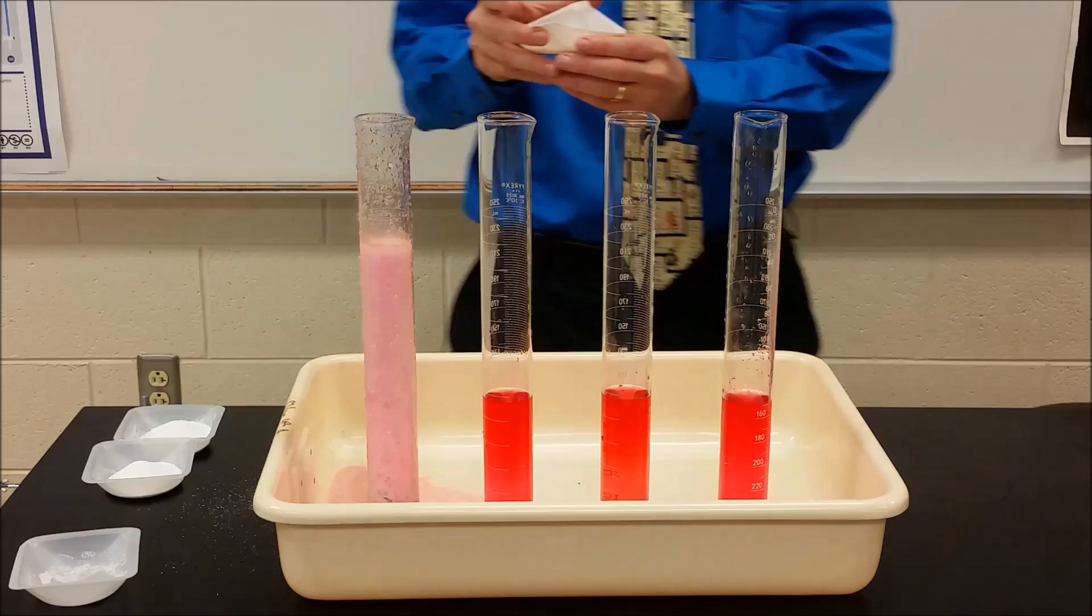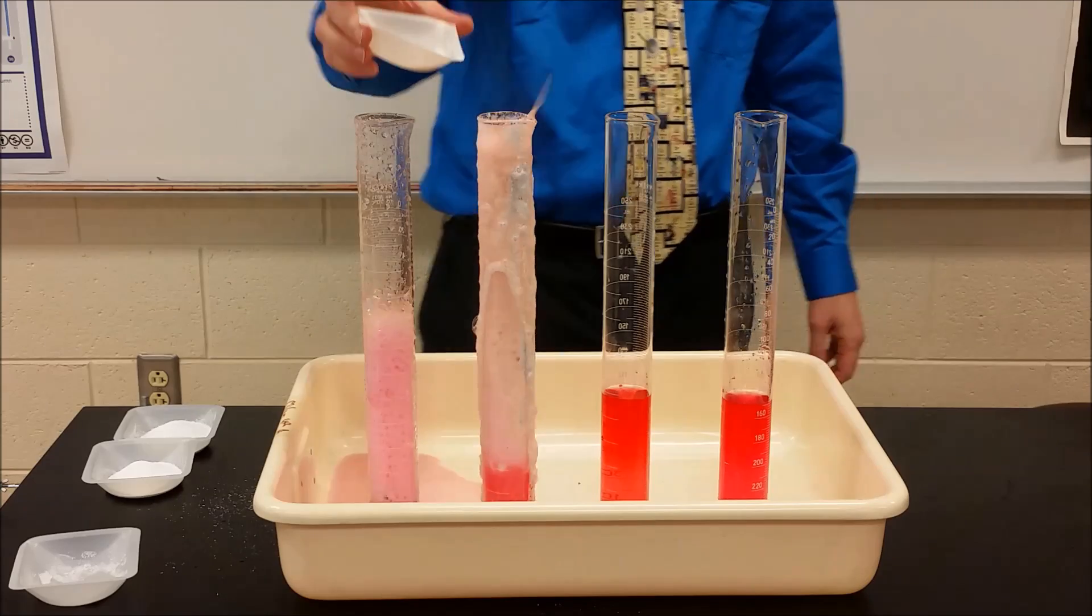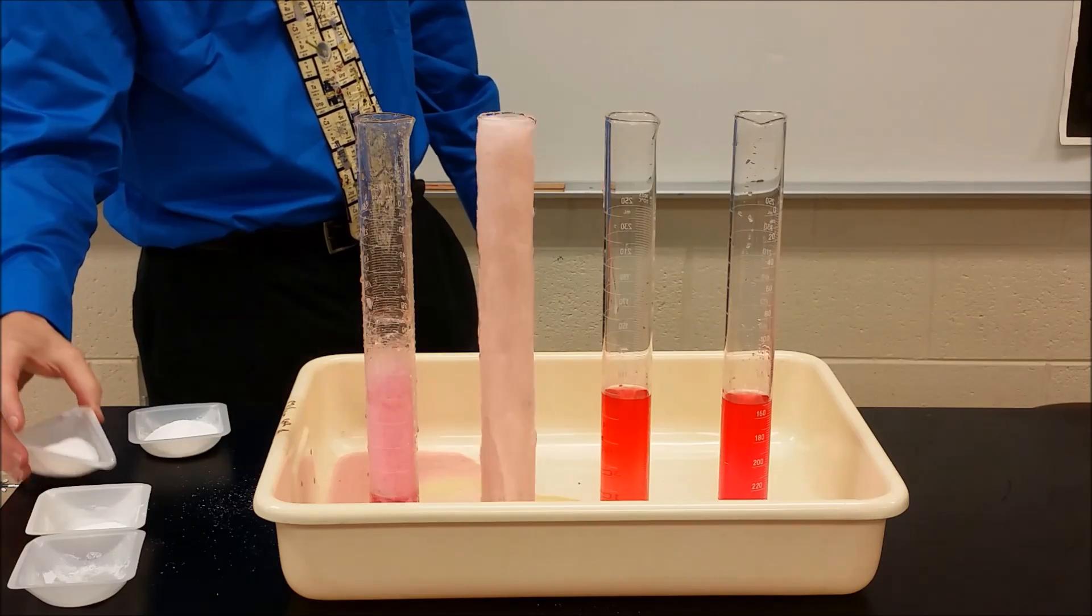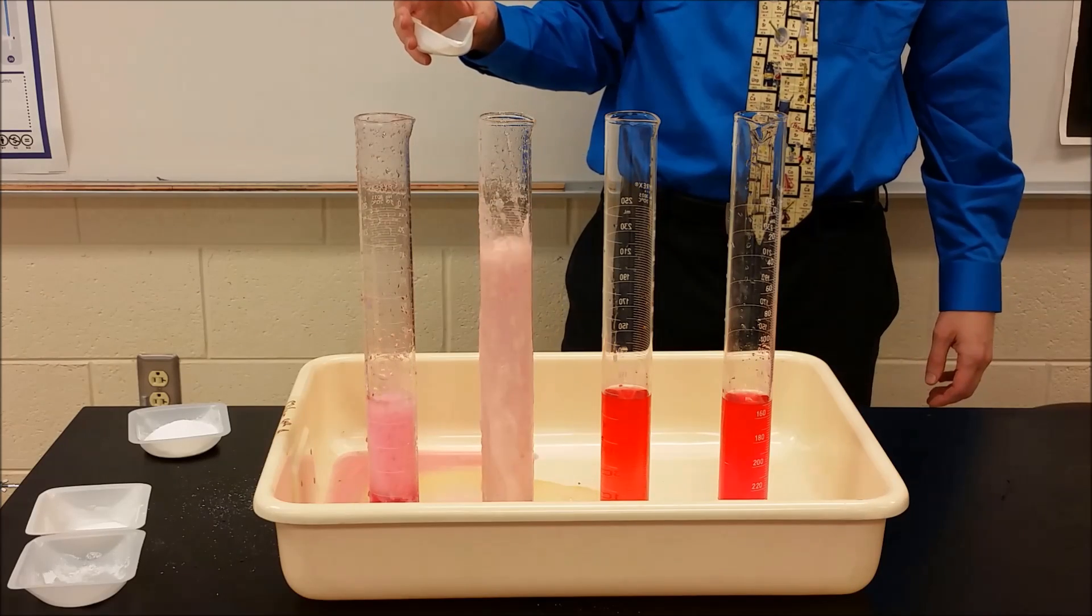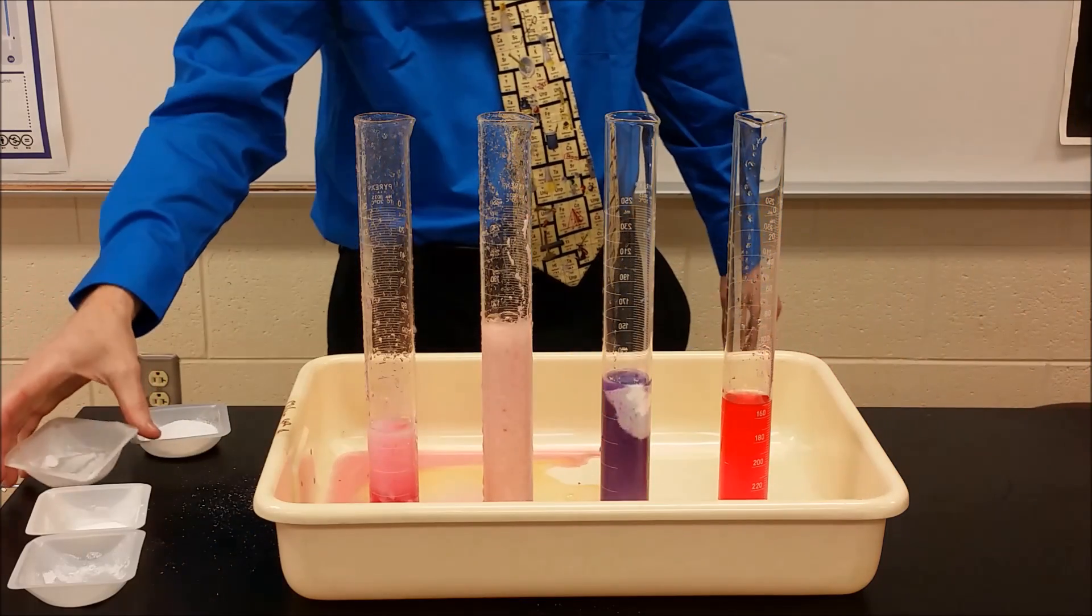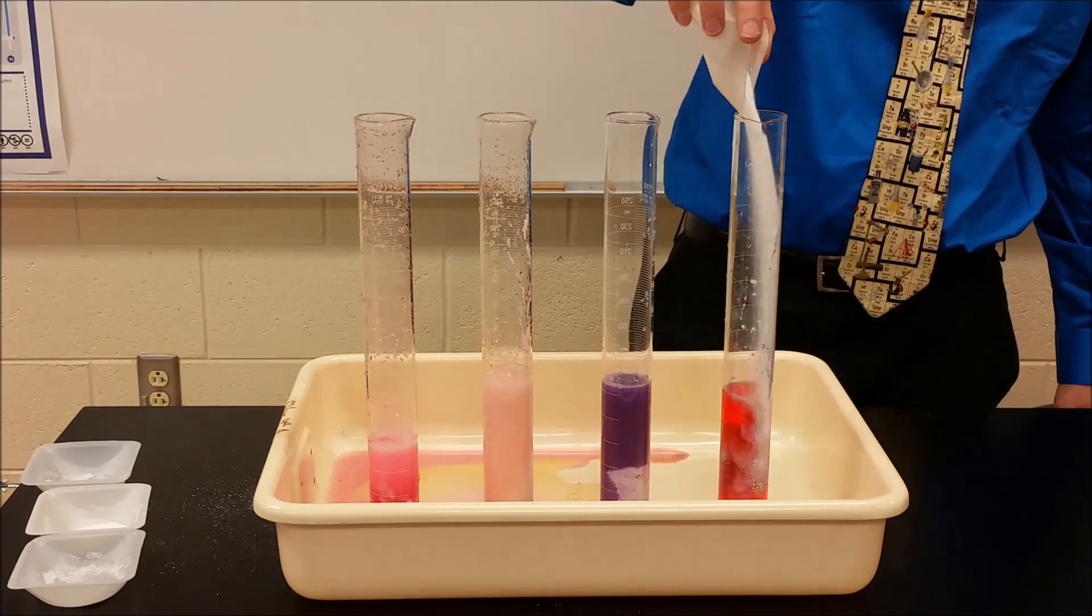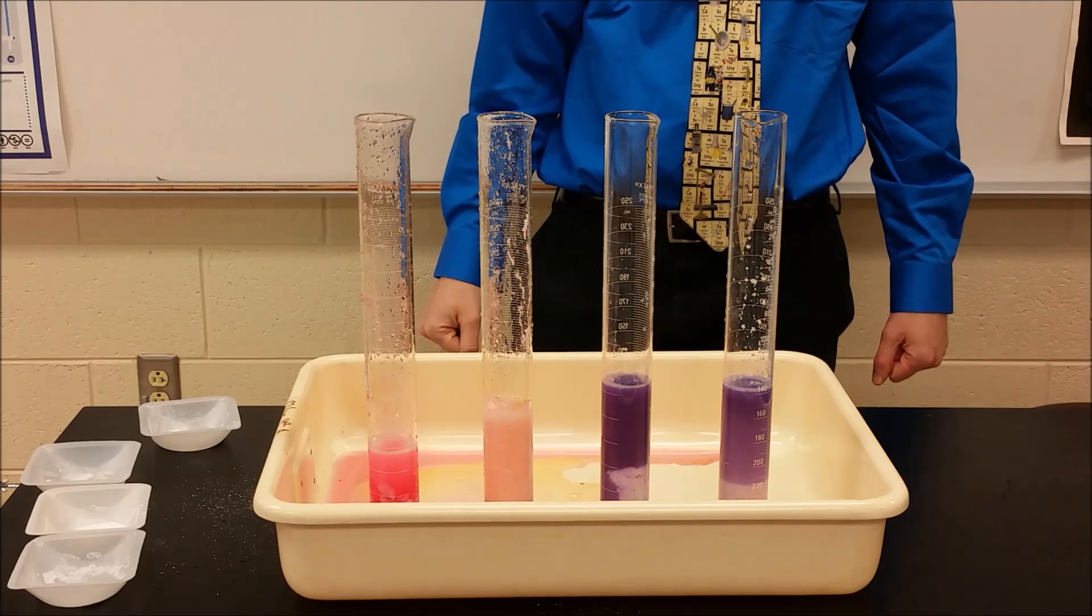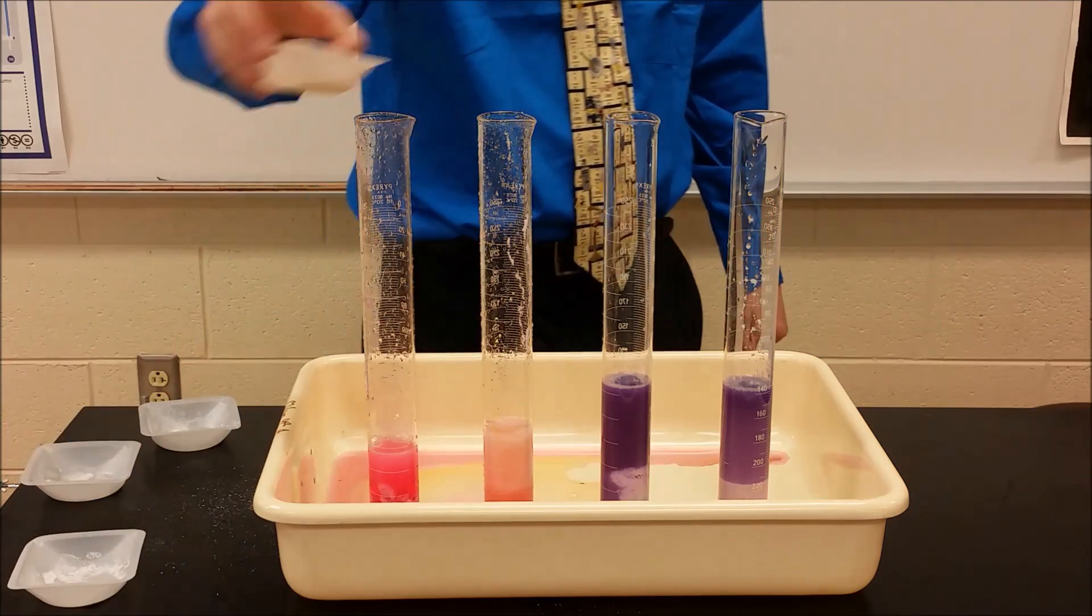Probably a little bit by surprise there. So strong and concentrated. Weak and concentrated, we're going to get all of it in there, back up. Let's throw it in the dilute. And weak and dilute. There's that.